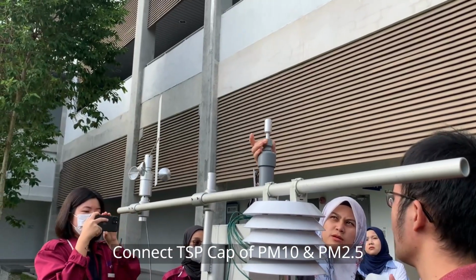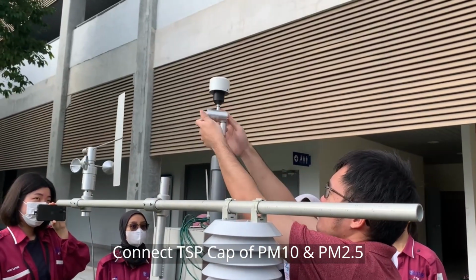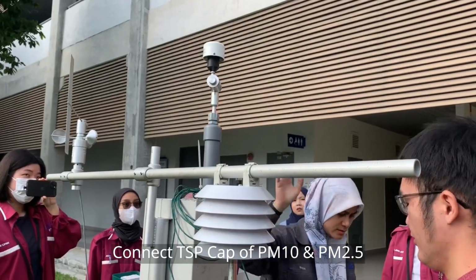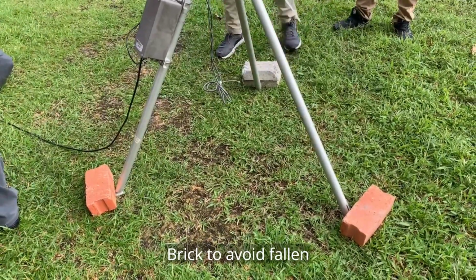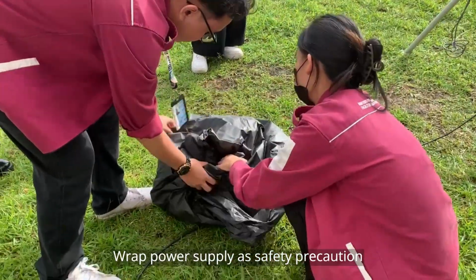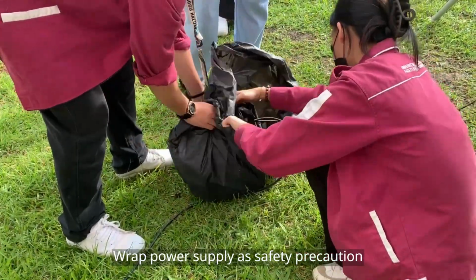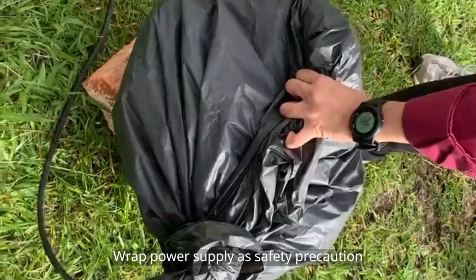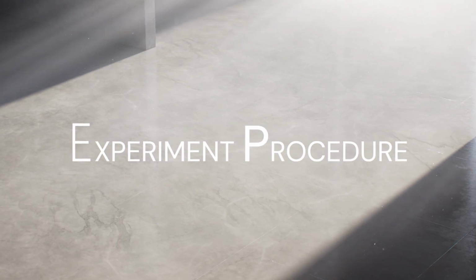After that, continue by connecting the cap of PM10 or PM2.5 on the sampler. To avoid a strong windy day, take a safety precaution by putting weight on every leg of the sampler. We also wrap the power supply with a plastic bag to avoid rainy days, because water can conduct electricity and bring harm to everyone. Then we put it on a brick to avoid direct contact with the field and soil as one of the safety precautions.